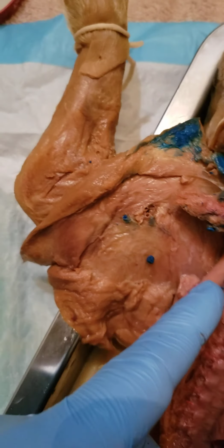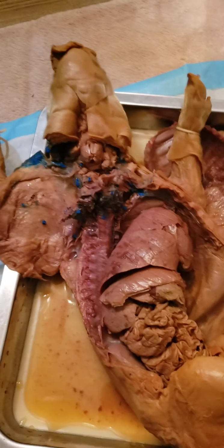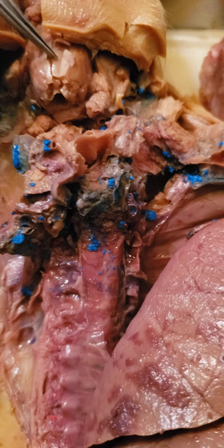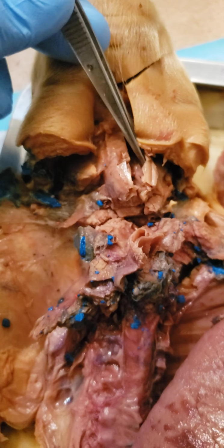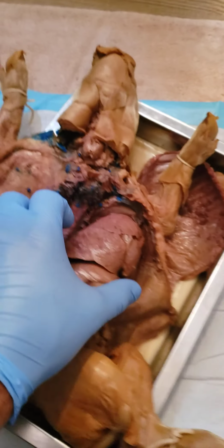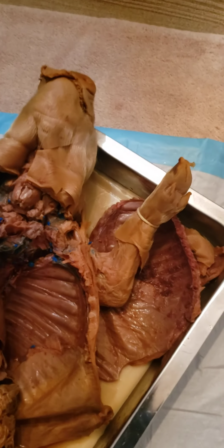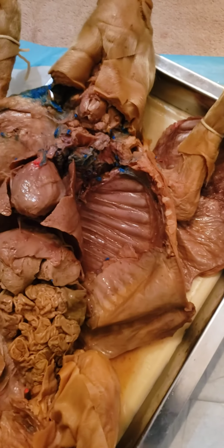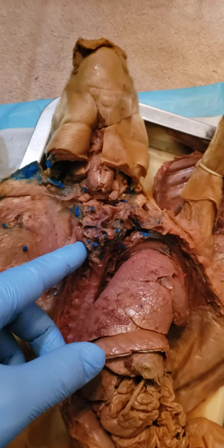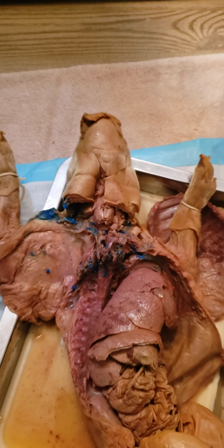I made a cut in them over here on the pig's right side. And last, on the inside, I made a cut, and here is the thymus down in the inside of the pig. So that pretty much covers all the parts of the pig, especially the ones that I was able to identify. It was pretty difficult for me, to be honest, making a lot of these incisions clean.